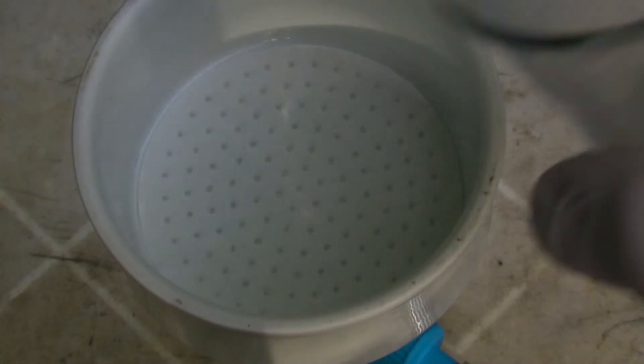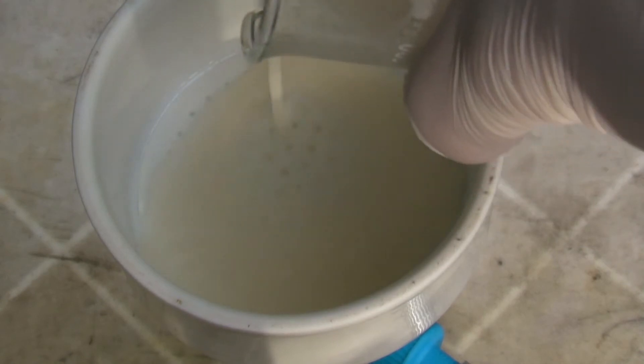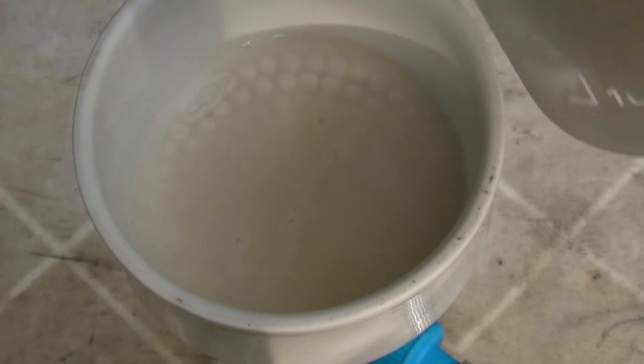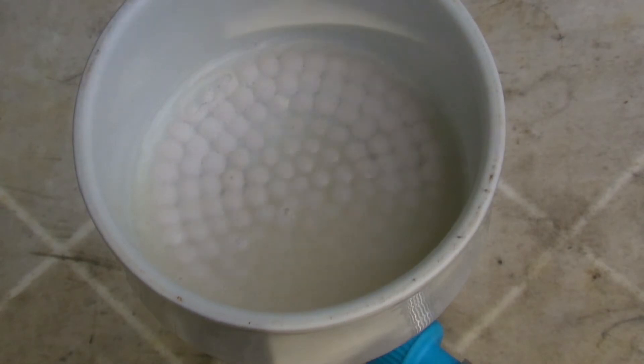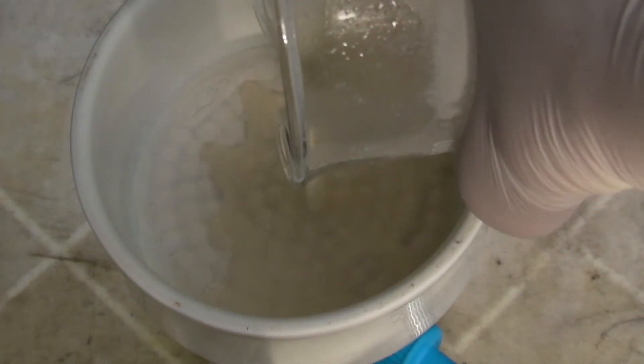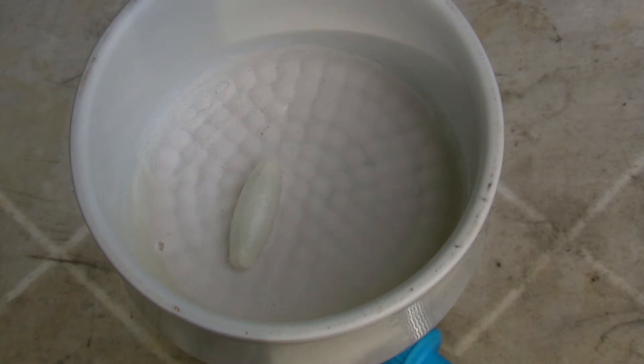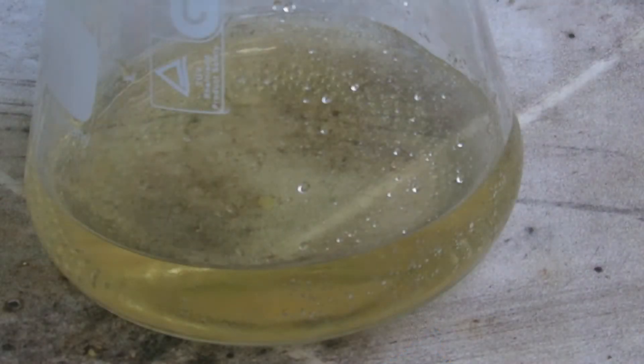Then the product was filtered off. The beaker was washed out with some water and the product was washed directly with some water. The filtrate was cooled further to see if more product might crystallize, but the amount was negligible, which is why it can be disposed of.